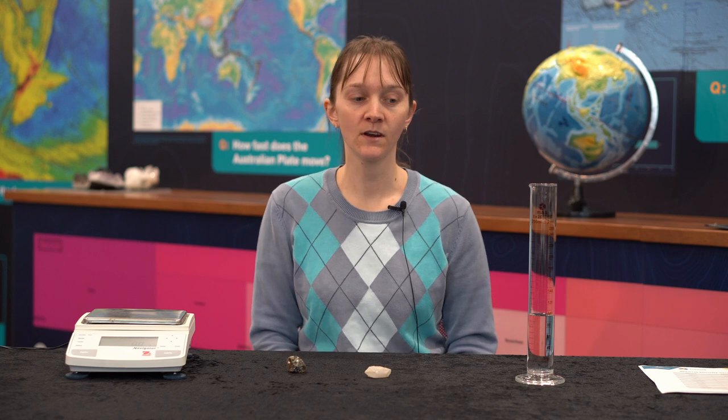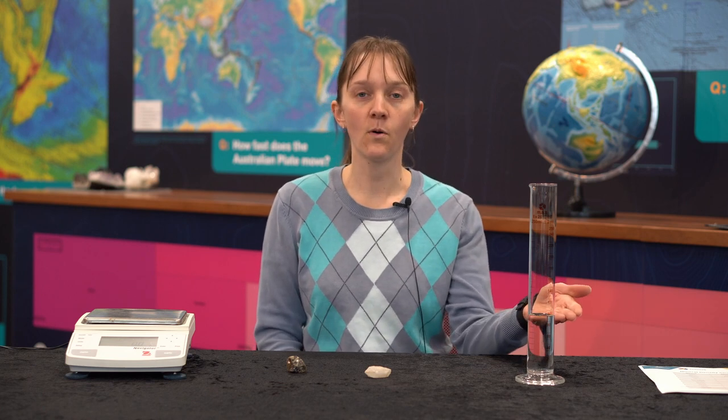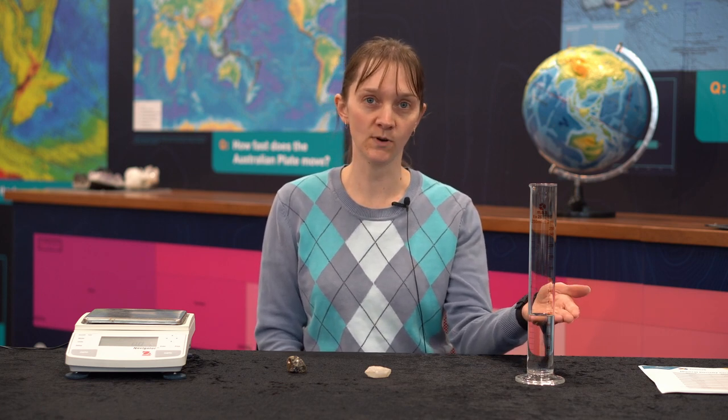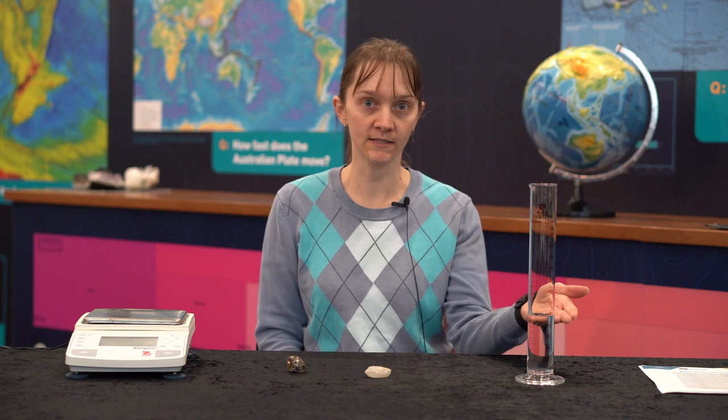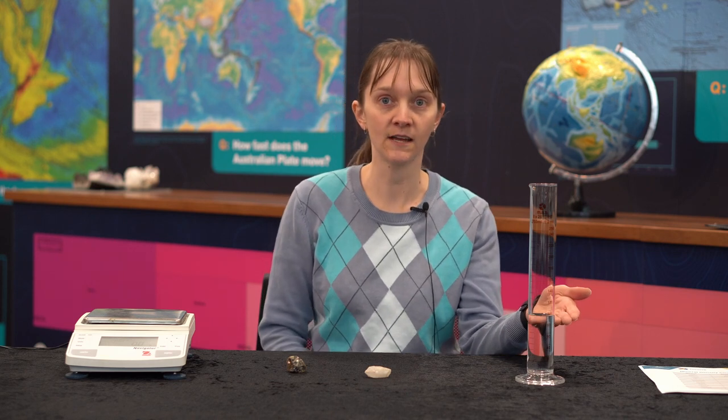To determine the volume of this specimen, firstly we're going to pour 100 millilitres of water into our graduated cylinder — you can see I've already done that.